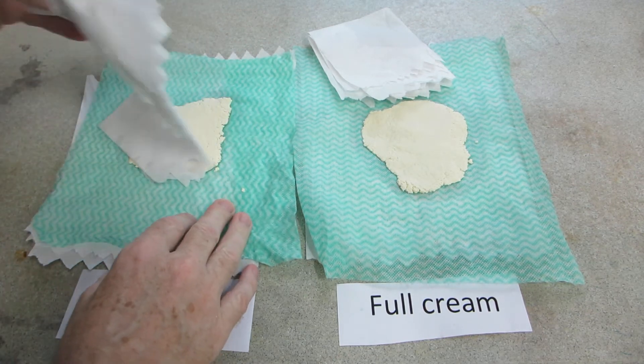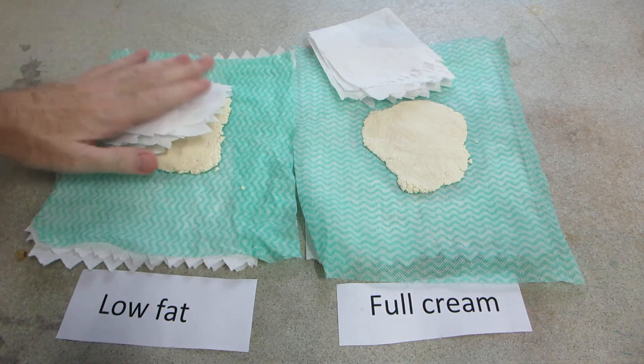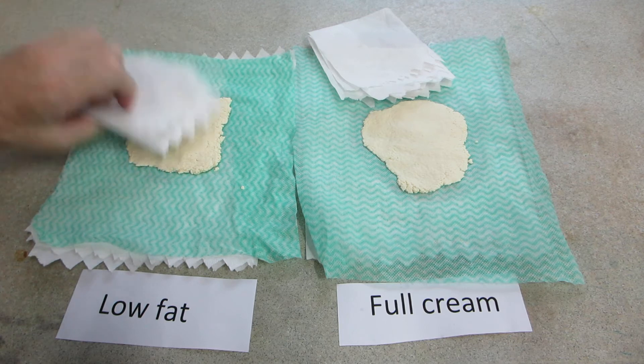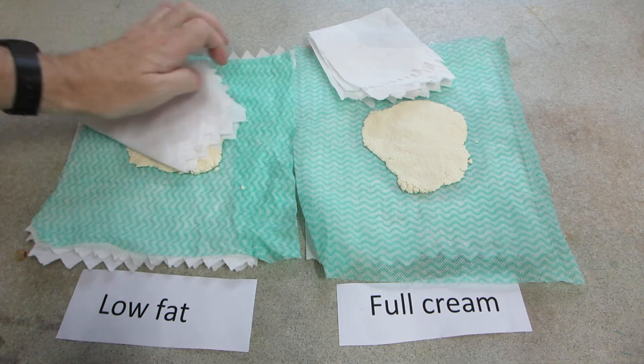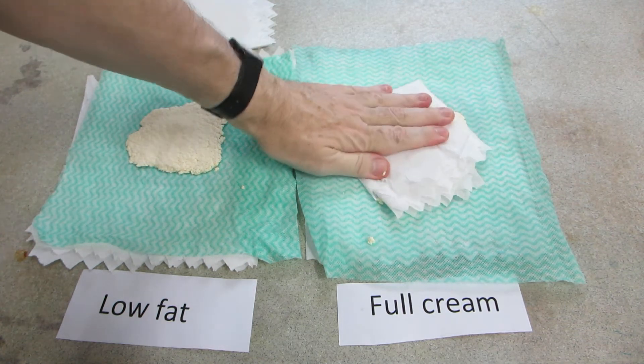If anything, the low-fat casein is a little bit more crumbly, just feels it as I'm pressing it, but I don't know if that will be borne out in reality. They're very similar.